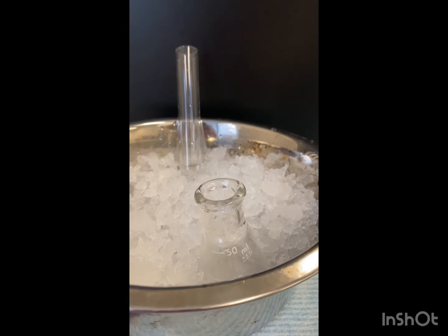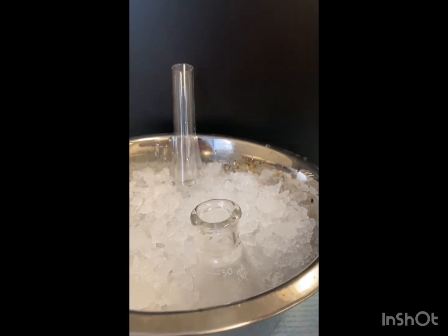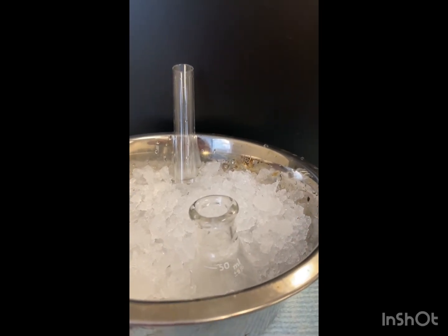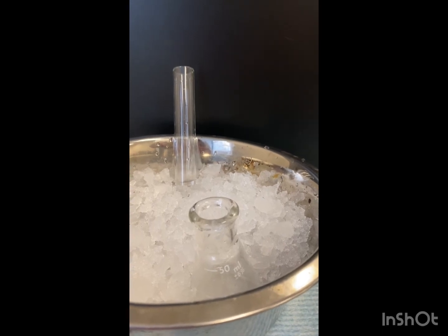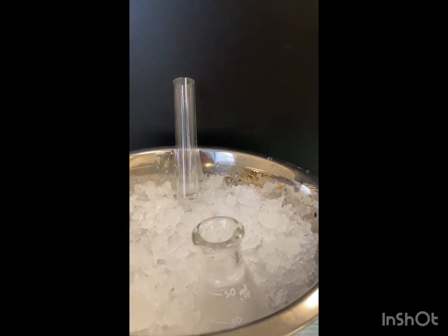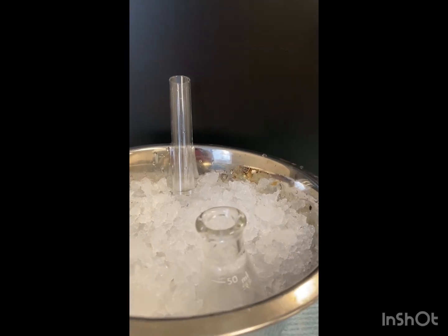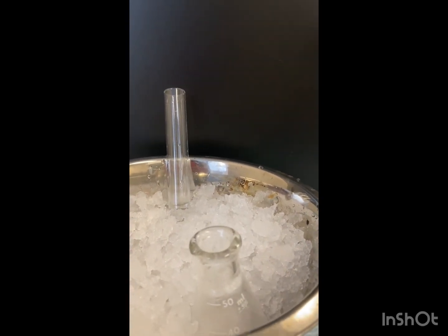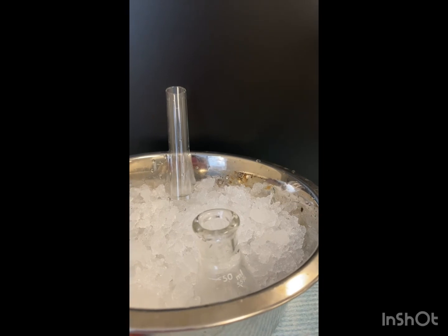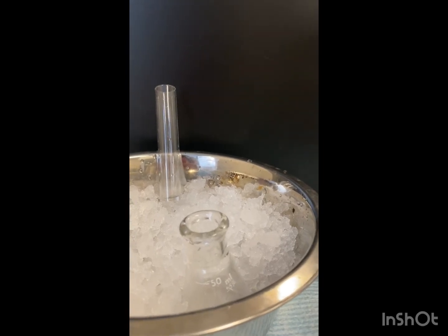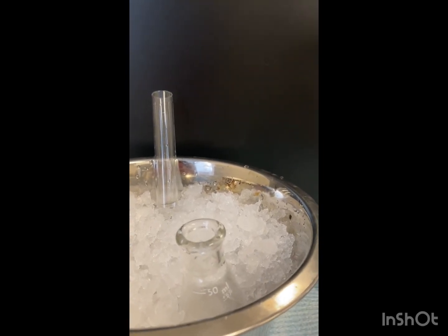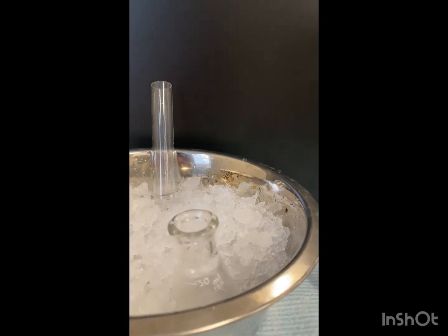It's cooled to temperature. So we have our flask with our filtered out benzoic acid. We also have in the back test tube just 10 mls of distilled water. We want that cool because we're going to use that to transfer it into our vacuum filtration.